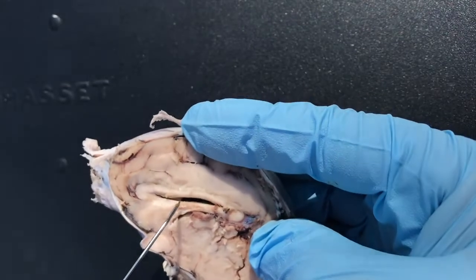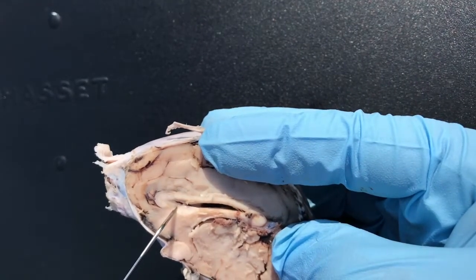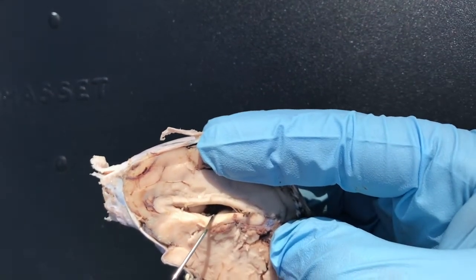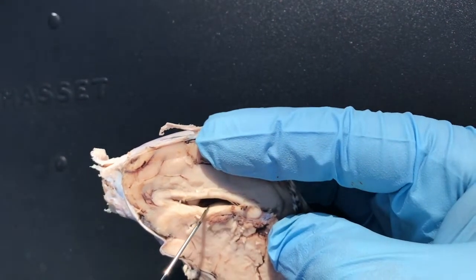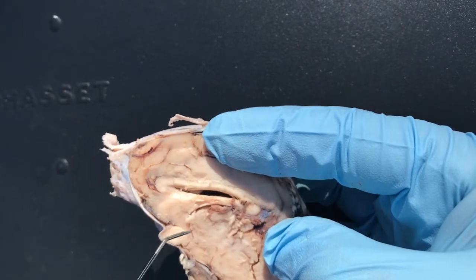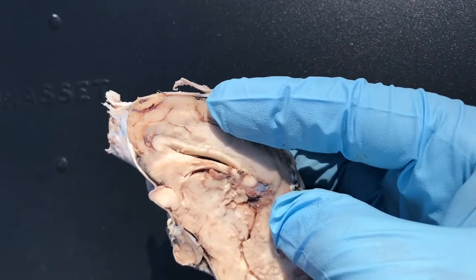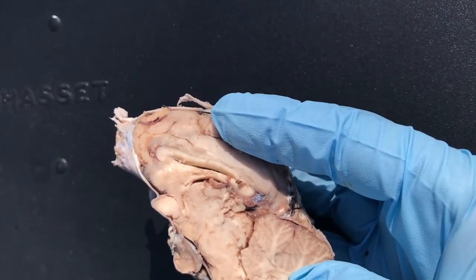So if we want to go through where the CSF travels — again, you have that membrane that I kind of tore right here, and that's your septum pellucidum. If you tear it, you can see you have a cavity. Inside here, you have your cerebrospinal fluid, and this cavity is called the lateral ventricle. You have two of those, one on each side — that'd be one and two. Then you have your third ventricle. Then it travels down the cerebral aqueduct, and then there's a little pocket that goes into the cerebellum — that's your fourth ventricle.